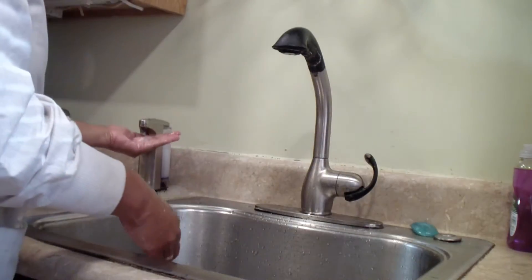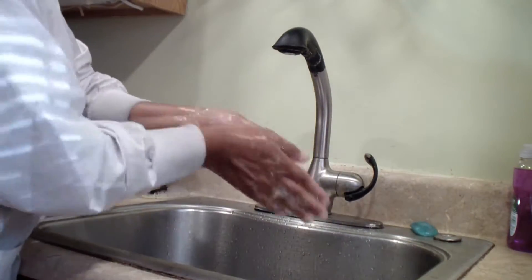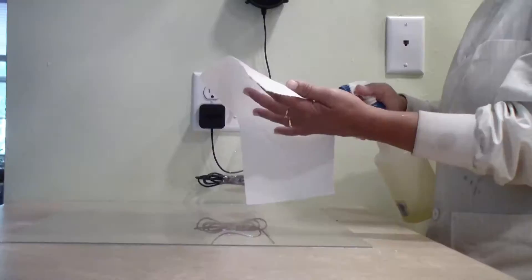This video will demonstrate how to obtain a sample from the environment. Wash your hands, wipe down your work area.